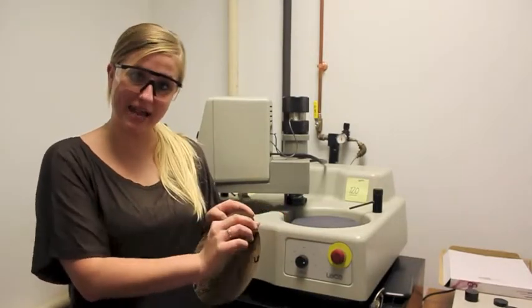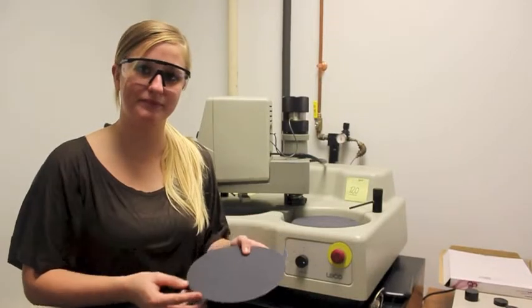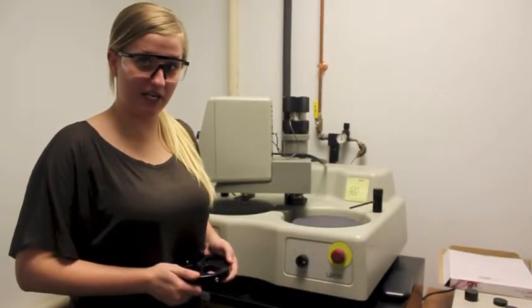Next, you will want to choose your desired grit, remove the back plastic, and place adhesive side down on the polishing disc. For our example, we will be using 120 grit.